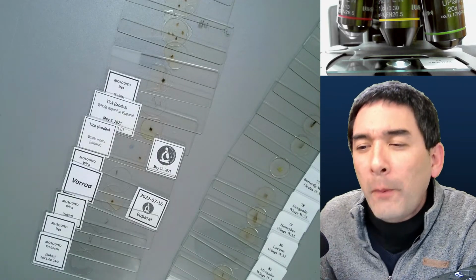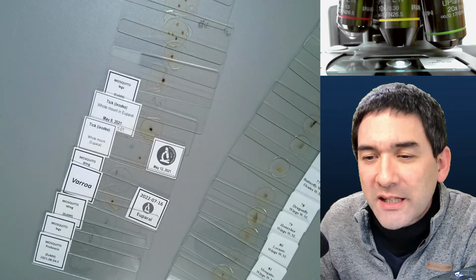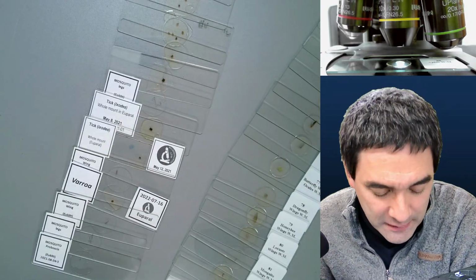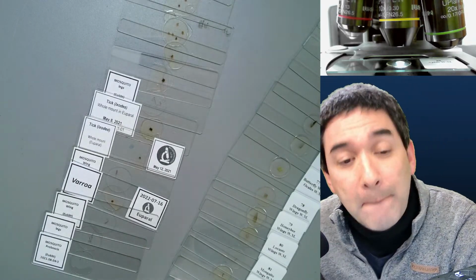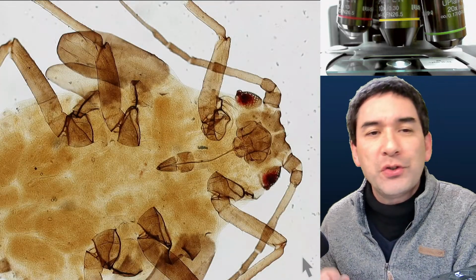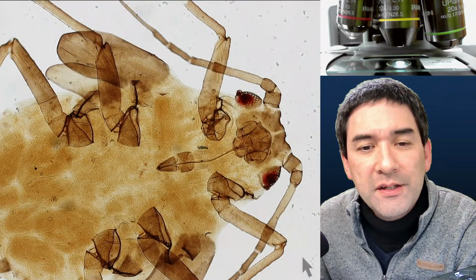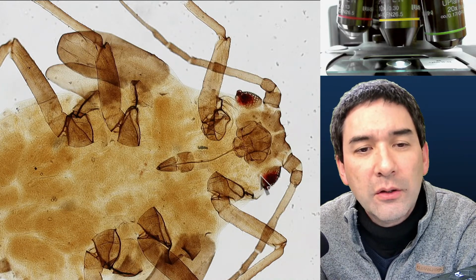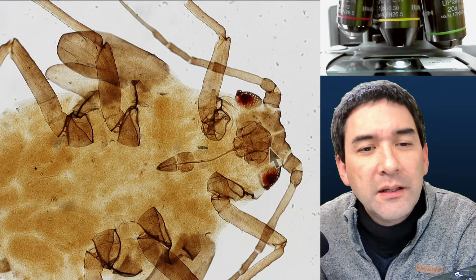And will you show compound eyes? That has been a question right now as well, and the answer is yes. As a matter of fact, I'm going to do that. But a tiny little bit of biology I'm also going to do here. This here is an aphid, and we can already see here the compound eyes, and it's an insect.